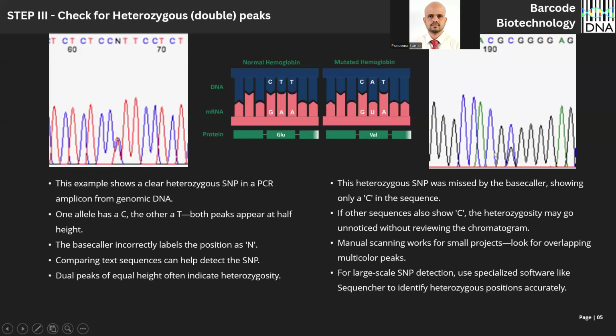And here also, see here in the 192nd position, this is not baseline noise. The peaks are very prominent. They can be guanine or cytosine. Okay, but see how boldly the software calls it a cytosine. So especially people who are working with single nucleotide polymorphism need to inspect the chromatogram very carefully. It doesn't mean only an N in the nucleotide text is a cue for single nucleotide polymorphism. Even the software will boldly call the N position a C. So you need to carefully check those regions.